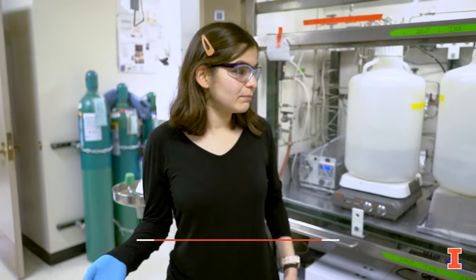Hello, I'm Zeynep. I'm a fourth year in the Flaherty Group. Right now we're going to be taking a look at some custom-made reactor systems in the lab.